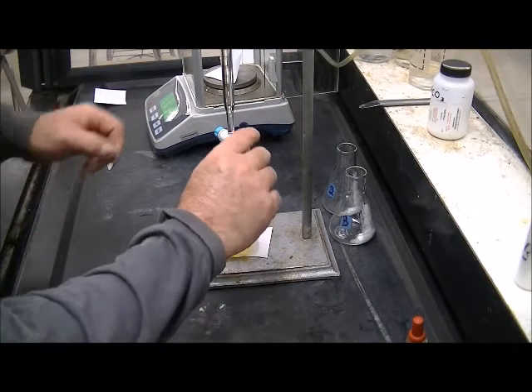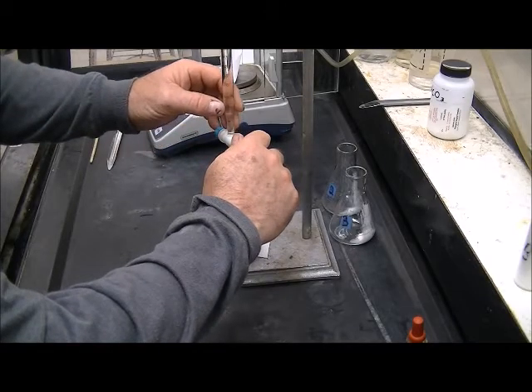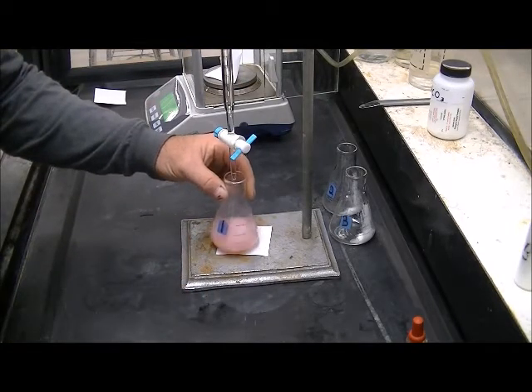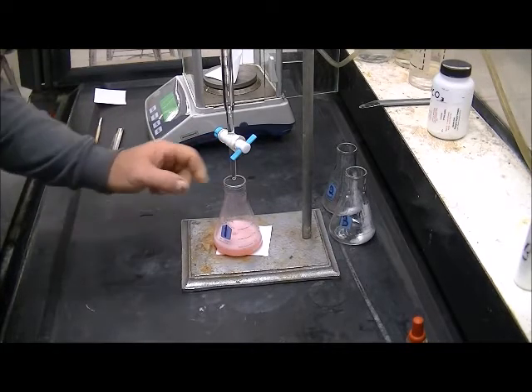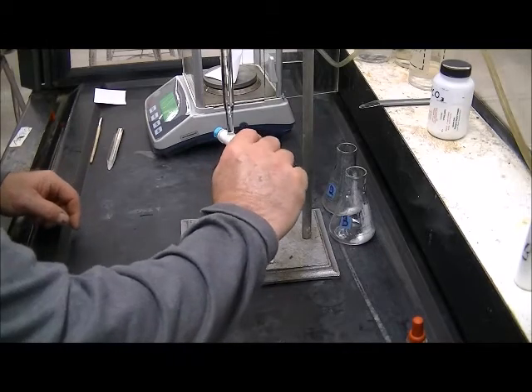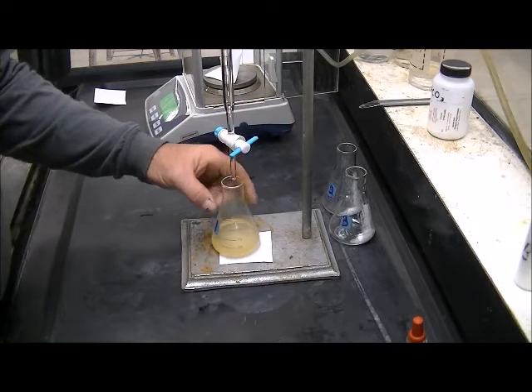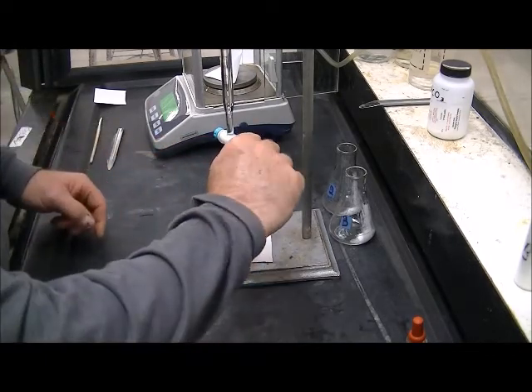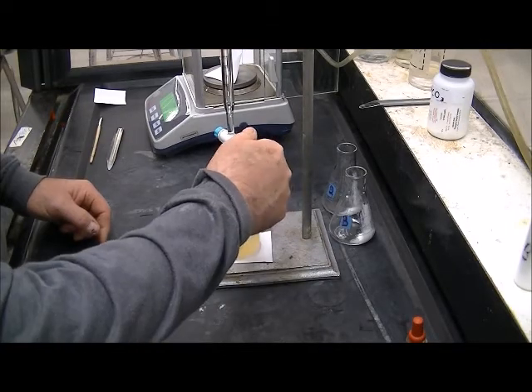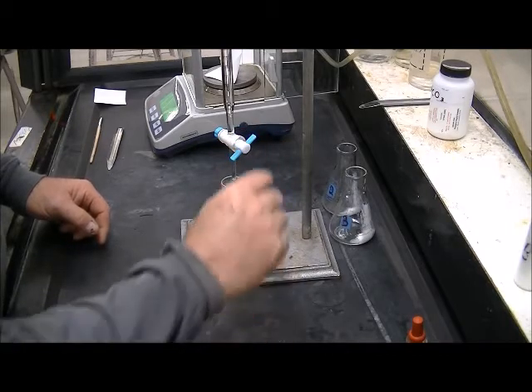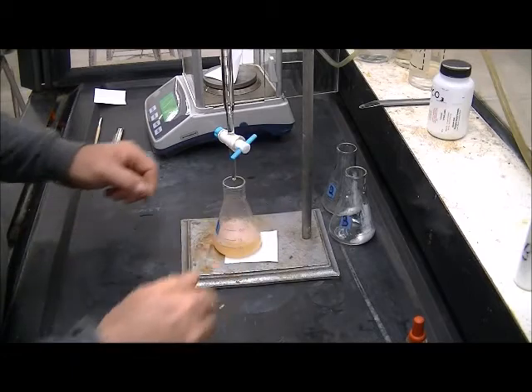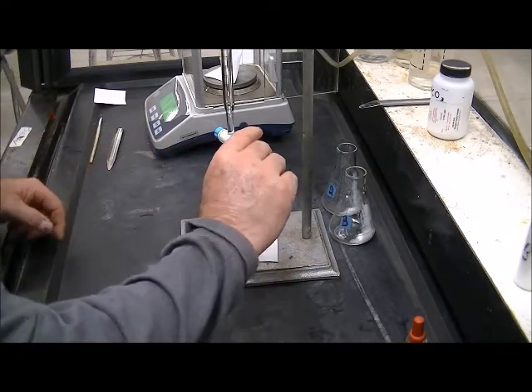And then I'm going to run in about 20 milliliters of our titrant to start with. This is the first of these samples so I'm not really sure how much it's going to use yet. So we're going to be cautious here. And I still have quite a bit of undissolved solids so I can probably put in another milliliter or two. And it turned back right away. And that turned back right away. As did that. And it's still taking more. Lots of fizzing still. A little slower there so we're going to slow down on our addition.